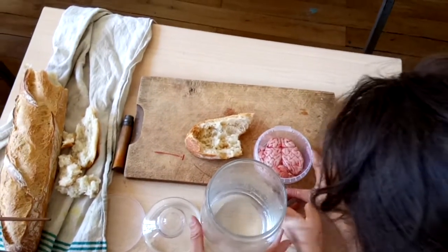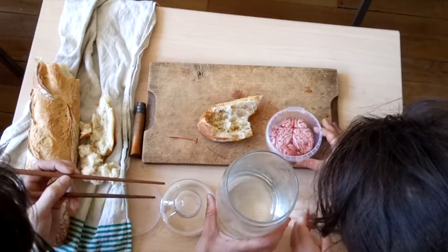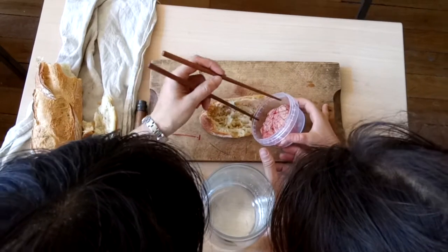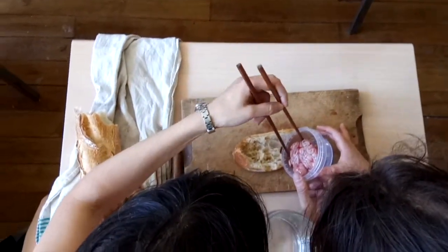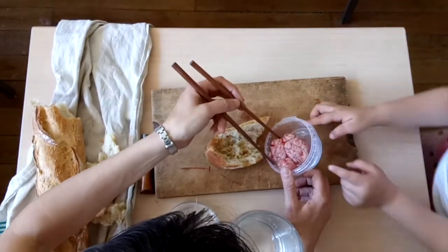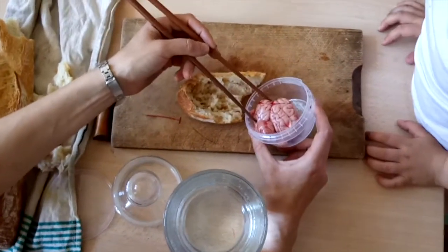You can't touch it. You can touch it a little, but you don't touch it. It looks like she will eat. First of all, what is happening here?